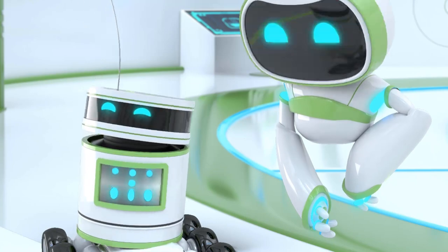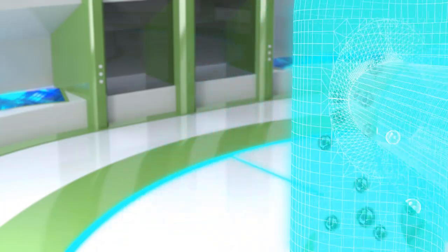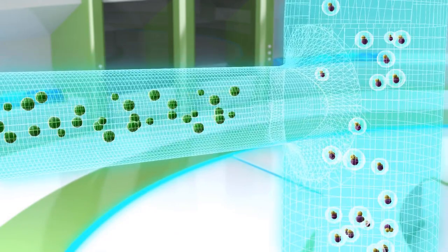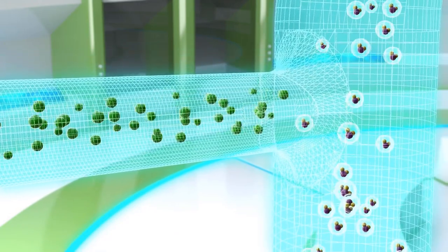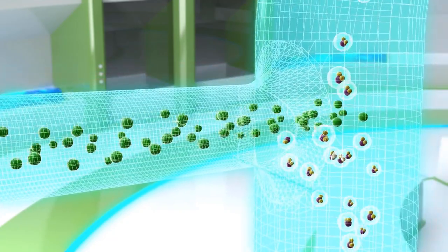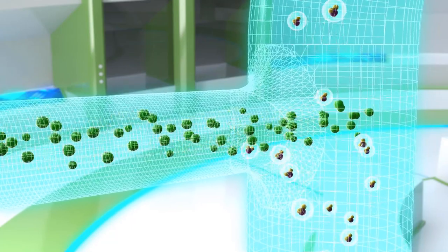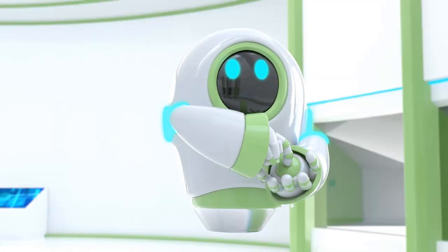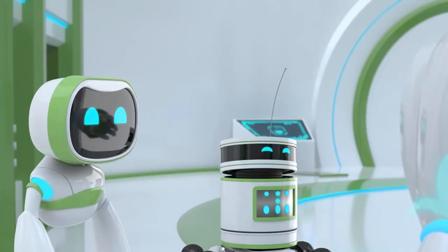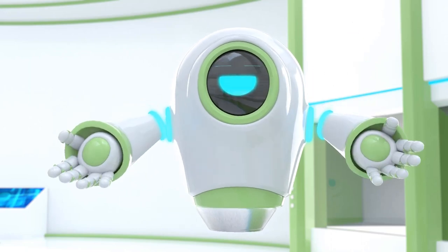I see. How does it work? AMS introduces a low flow of argon into the sample aerosol before it reaches the plasma. Some of the droplets will collide with each other as well as with the frosted sides of the spray chamber wall and are removed to waste, whereas others will carry on to the plasma. Because there is less solvent reaching the plasma, the solvent load in the plasma is lower, which in turn increases the plasma temperature.